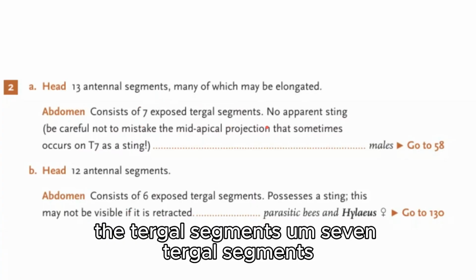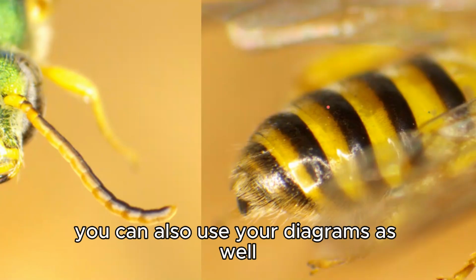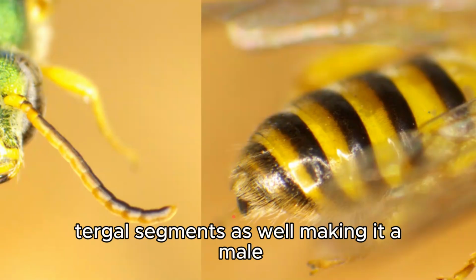7 tergal segments will be a male, and 6 will be a female, and the tergal segments are going to be on the abdomen. You can also use your diagrams as well to get familiar with a few of the parts. And so here we have 7 tergal segments as well, making it a male.